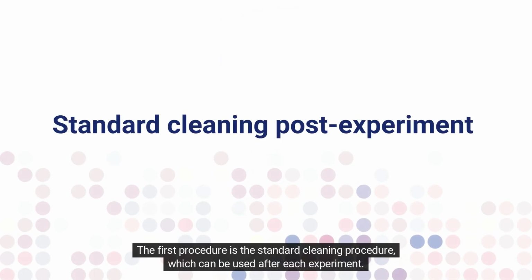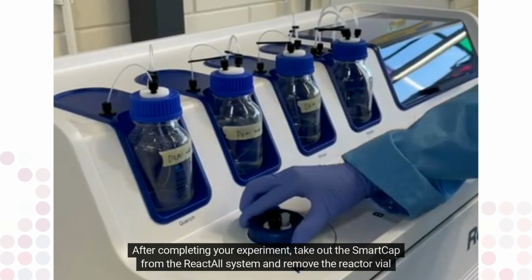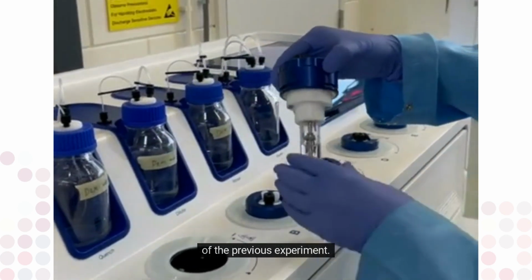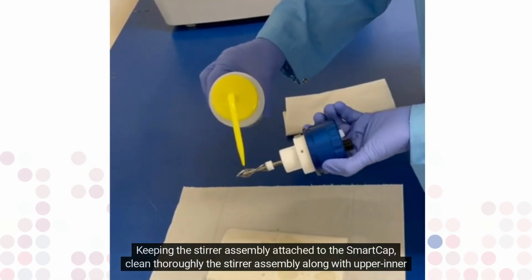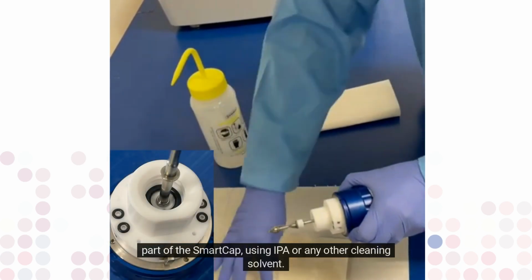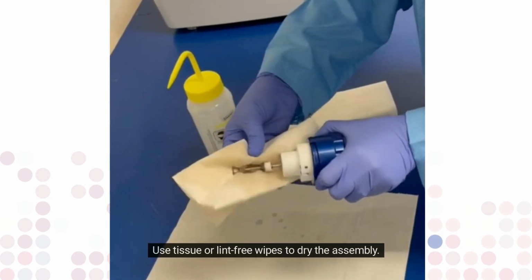The first procedure is the standard cleaning procedure, which can be used after each experiment. After completing your experiment, take out the SmartCap from the ReactALL system and remove the reactor vial of the previous experiment. Keeping the stirrer assembly attached to the SmartCap, clean thoroughly the stirrer assembly along with upper inner part of the SmartCap using IPA or any other cleaning solvent. Use tissue or lint-free wipes to dry the assembly.